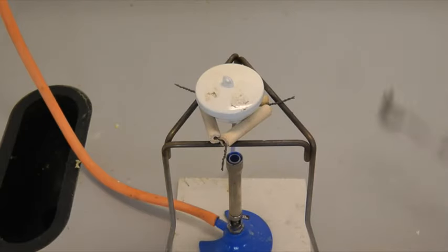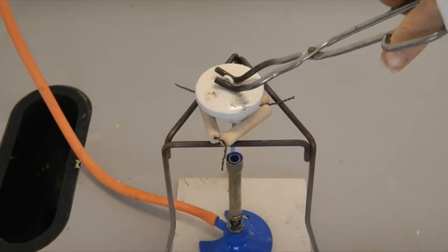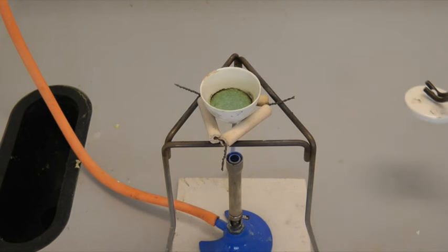You will be told how long to heat your crucible for. If instructed to do so by your teacher, you can safely remove the lid using a pair of tongs to inspect your reaction.